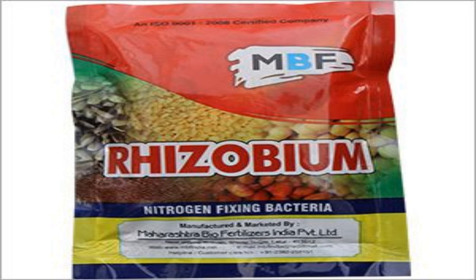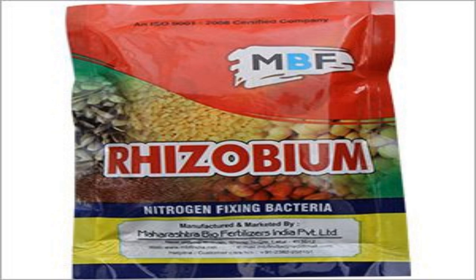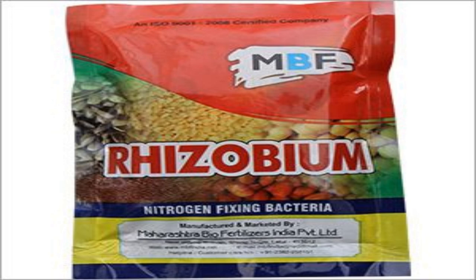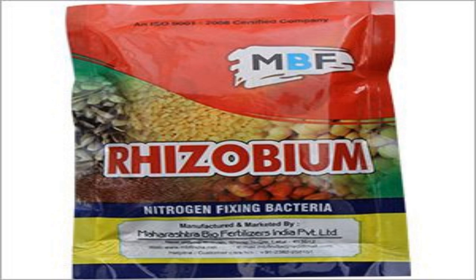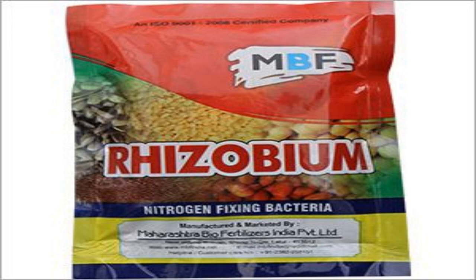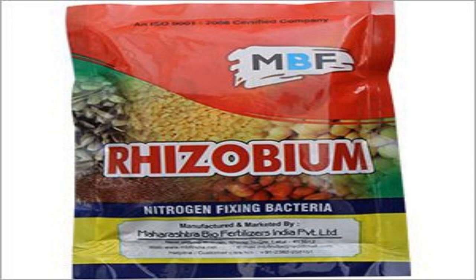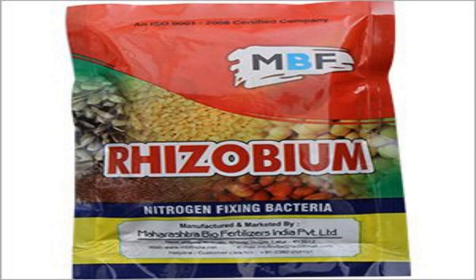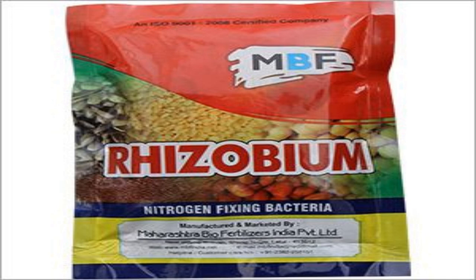For mass culture, rhizobium is mass-cultured in a large bioreactor to prepare inoculant. Yeast mannitol agar medium or sucrose mannitol medium is used. A suitable medium is formulated and filled into the bioreactor after proper sterilization. One liter of starter culture is inoculated into 100 liters of medium in the bioreactor.